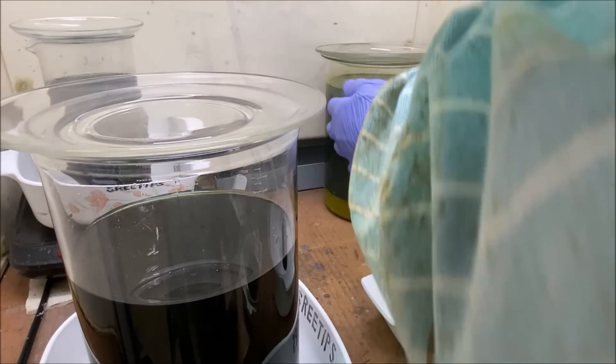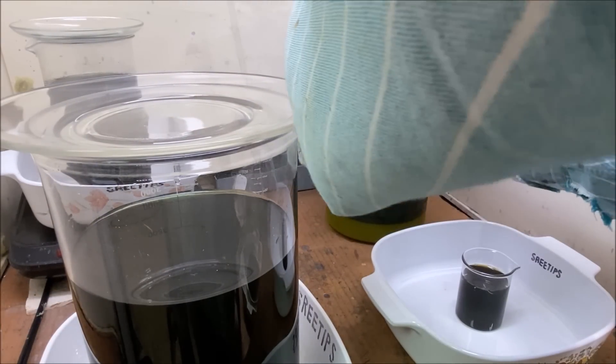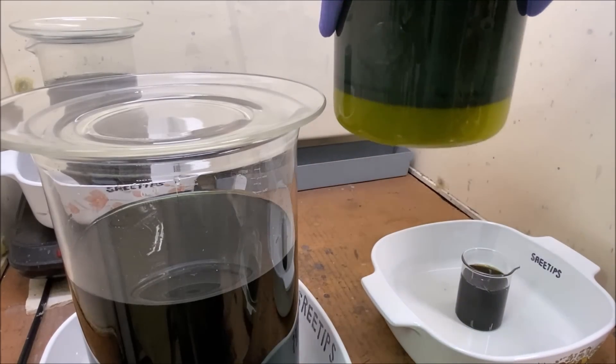Now let me reach in here and grab this. This has got our dmg precipitate in it.